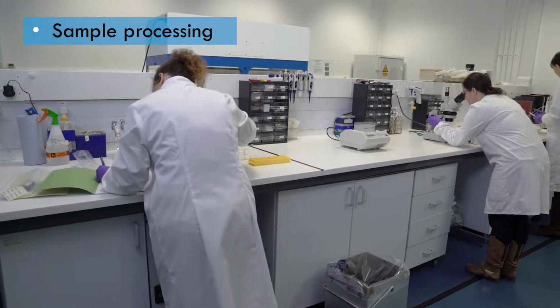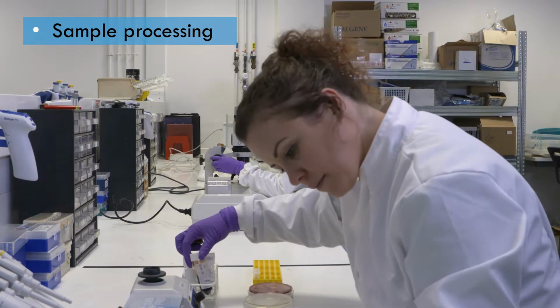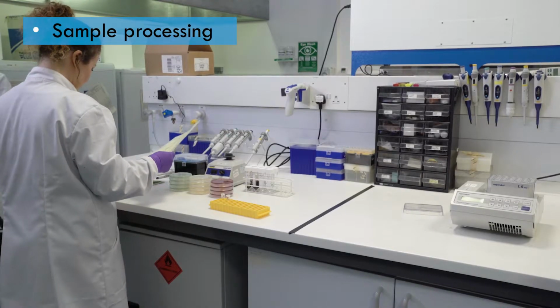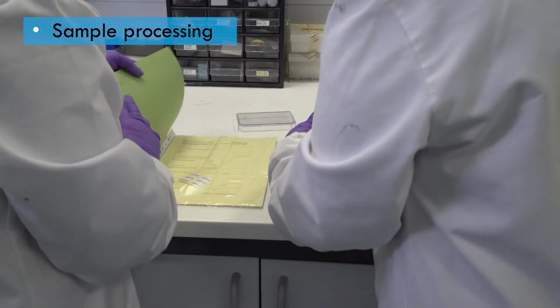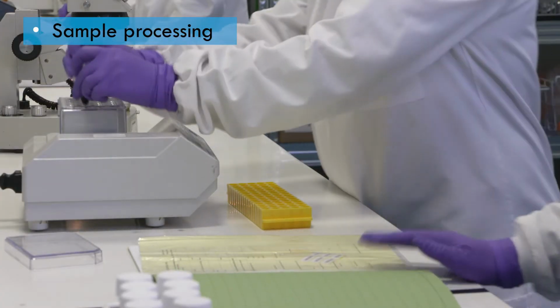Before processing the sample, make sure that the workspace is available, clean and tidy, and that reagents and other supplies are prepared and close to hand. Sign-off may be required for certain procedures prior to moving on to the next phase of the work. This will be useful for tracking the journey of the sample.